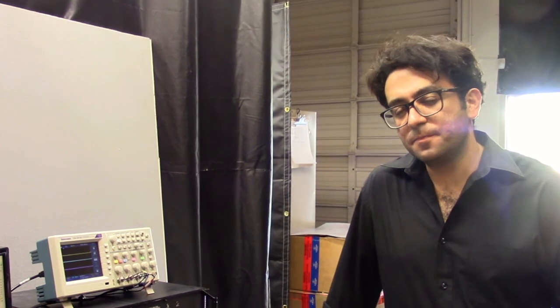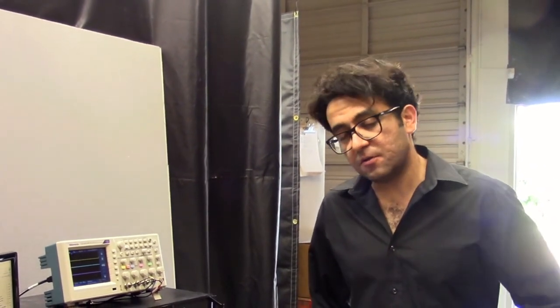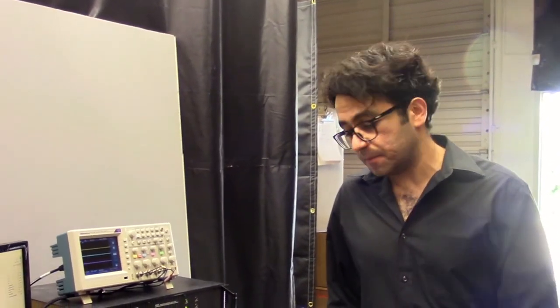The TK is one of many instruments that Artium makes that use the PDI method. The TK itself comes in 6 or 7 different packages and optical layouts to fit different applications, but we can also customize them to fit your application.